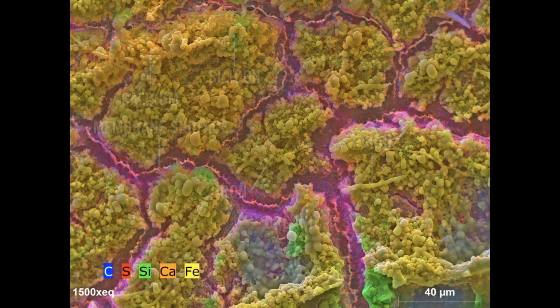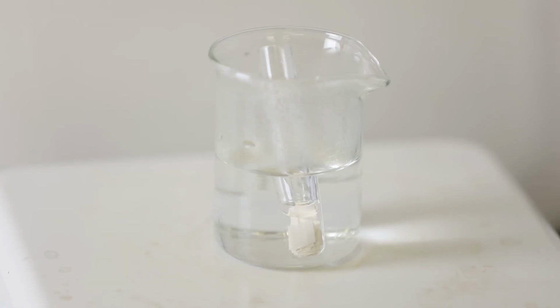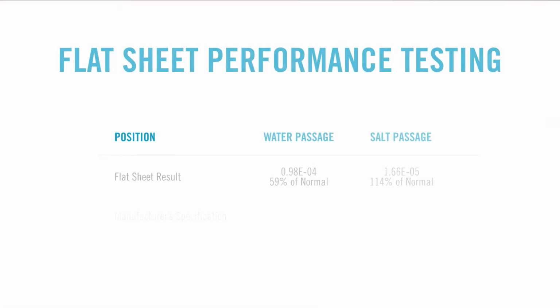Fujiwara testing is one of the ways we test for damage. Polyamide membranes are not compatible with chlorine. Fujiwara testing is a quick test. We cut up little pieces of the membrane, we place the test tube in a water bath, and we boil it. The reagents in contact with the membrane surface will cause the chlorine, if it's present, to break off of the membrane material, boiling through a secondary layer. For this analysis, we found a color change to a vibrant pink color you'll see here. This means that chlorine damage has occurred to the membrane surface.